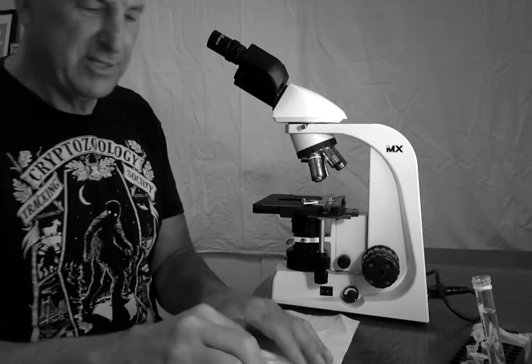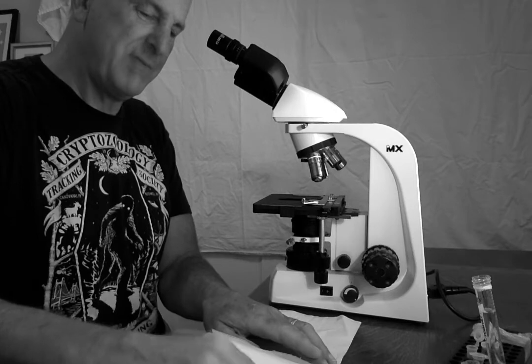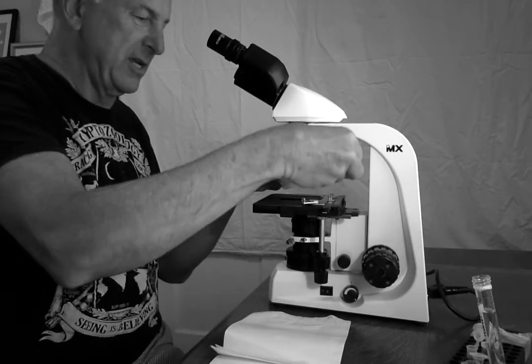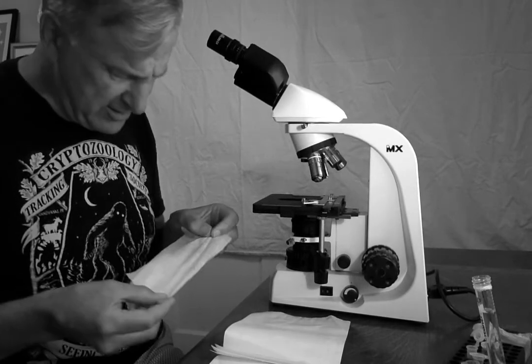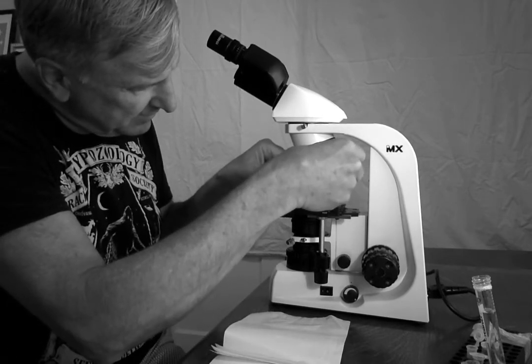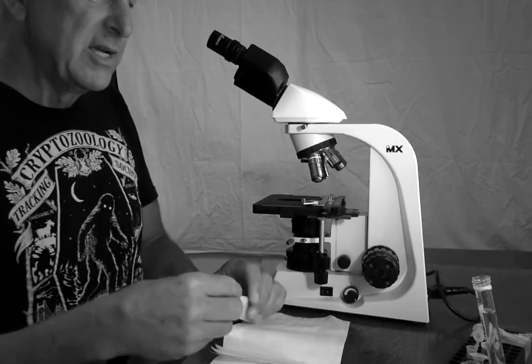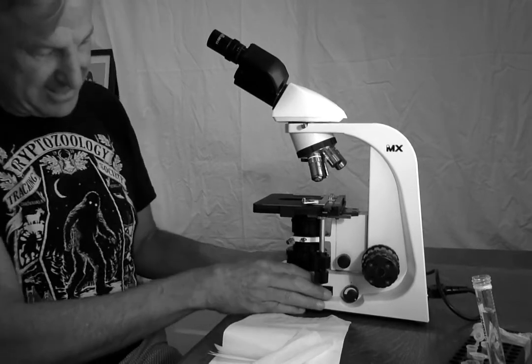And for this video, I'm going to be convinced that there's no oil. But I'm going to give it a little dry off. Let's give it a dry. And I don't see, you know what? I see a little oil. So let's get up here, and I may have to repeat those steps again. So I'm going to keep going till I don't see any evidence of oil on this. But let's say I did.